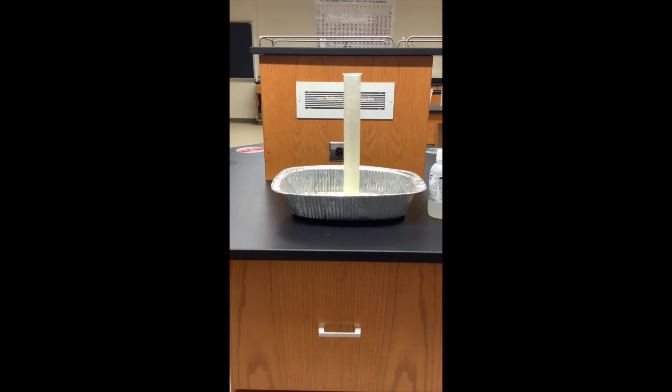So hydrogen peroxide is usually sold in stores in the brown opaque bottles. It's something that you use to clean up cuts. It will react by itself without any external force to create water and oxygen gas. So we are going to trap the oxygen gas bubbles inside of some regular dish soap. So we'll be able to see the rate of the chemical reaction by how many bubbles are produced.